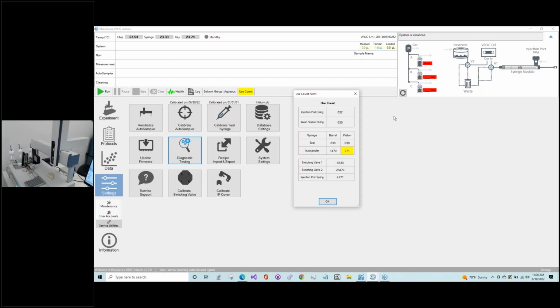All right. So first, I'm going to show you guys how to change this test syringe here. There is a screw here that we'll need to get off. I like to get that off first. There isn't really an order you need to go through; I think it's more of a preference. Just double check what tool I need.